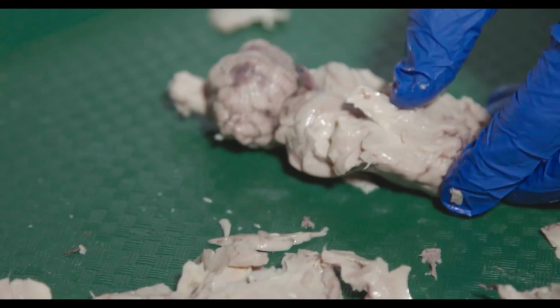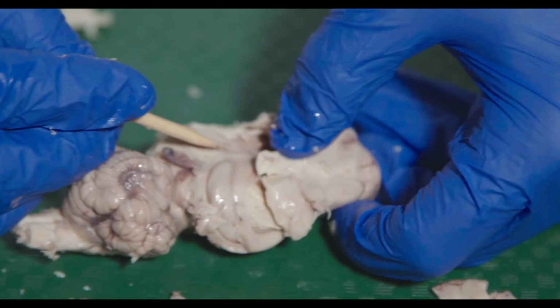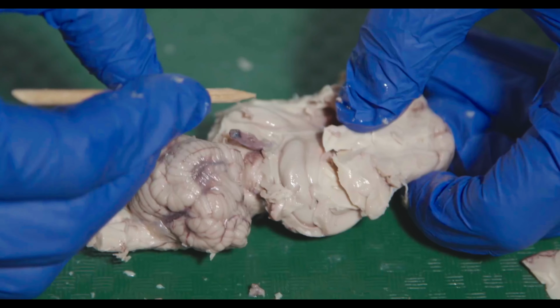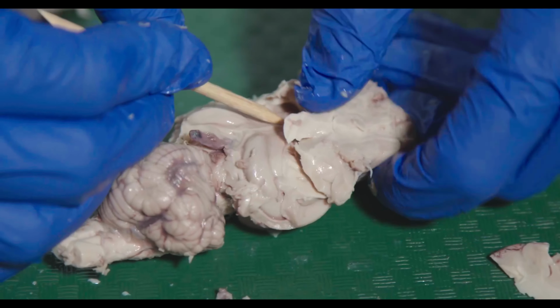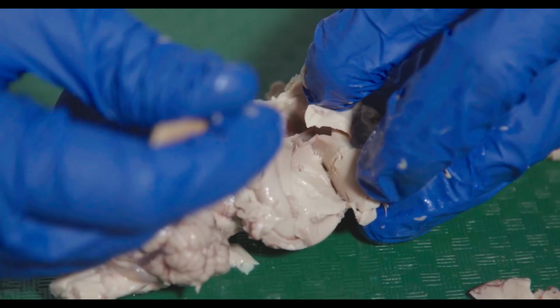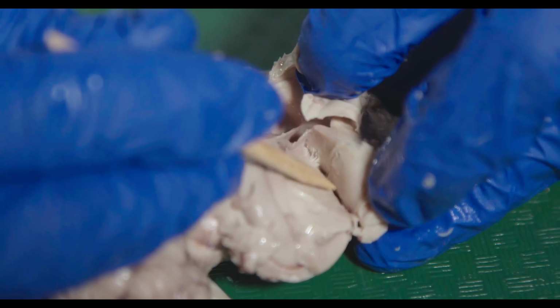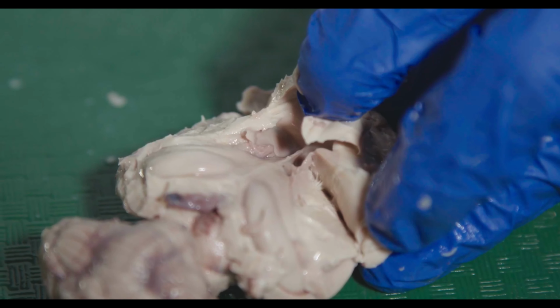So here you can kind of see the hippocampus right here. So this is your hippocampus kind of wrapping around, and this is where the fibers come together to eventually form the fornix, and they kind of go down in here. If you peek into this cavity, it's the lateral ventricle, you can see the caudate head, these bumps on either side. Now I've cut into the caudate here, but you can see where they are if you peek down.